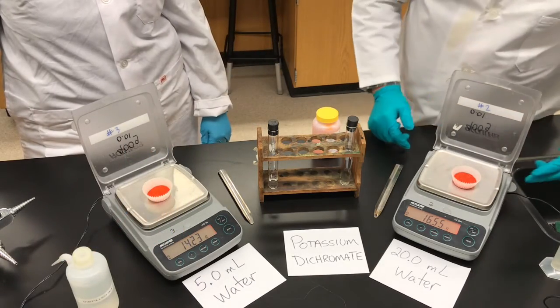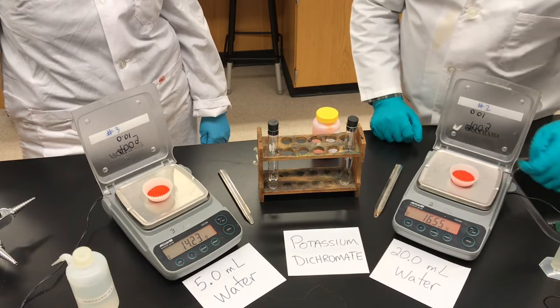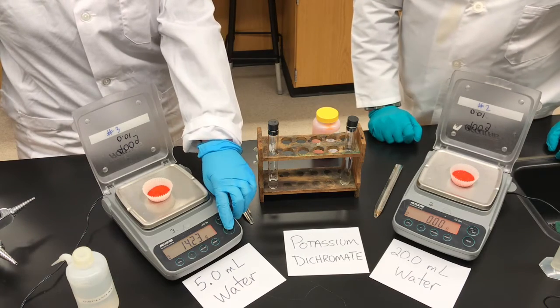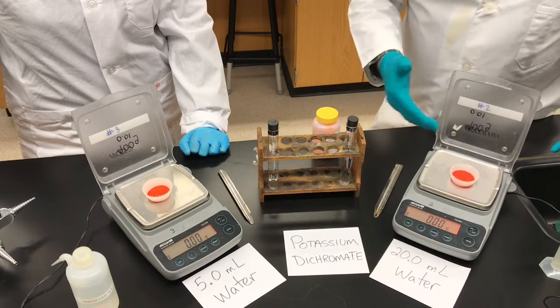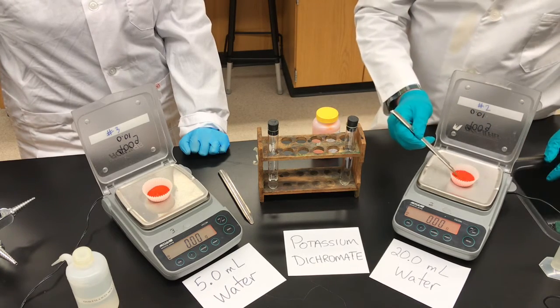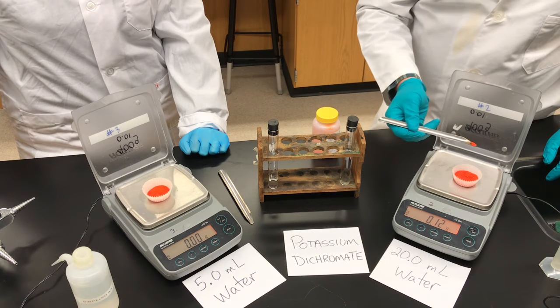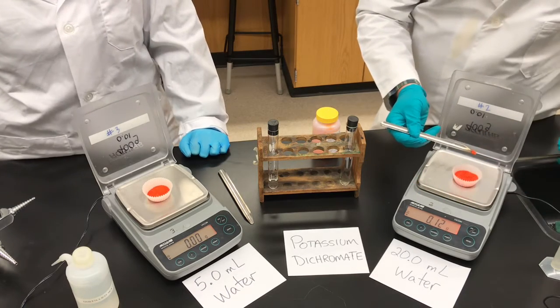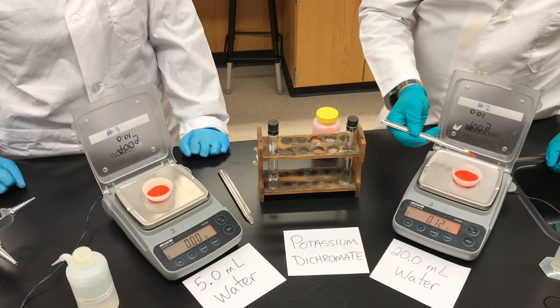We've placed a cupcake holder with the salt on the balance and it's reading a mass. I'm going to zero the balance. As you know from using balances in the past, it's now pretending there's nothing on the pan. If I reach in with my scoop and remove some of the salt, the mass will show a negative number — it now says negative 0.12, which means I've taken out 0.12 grams.